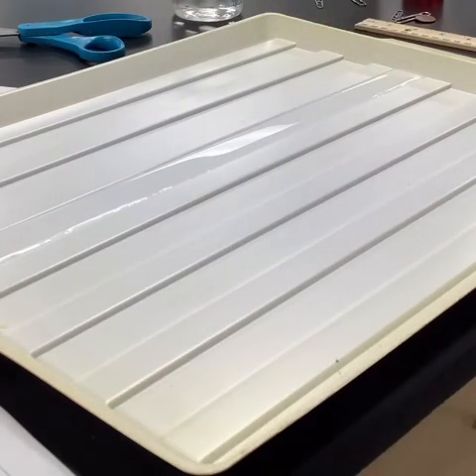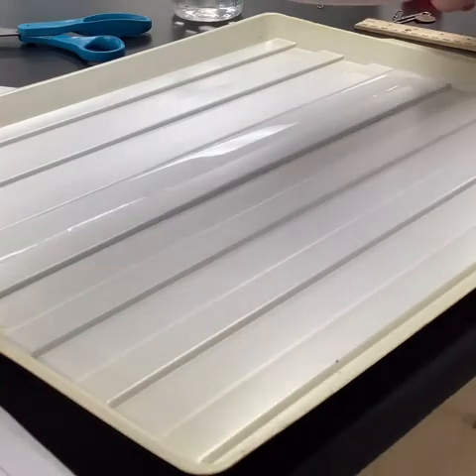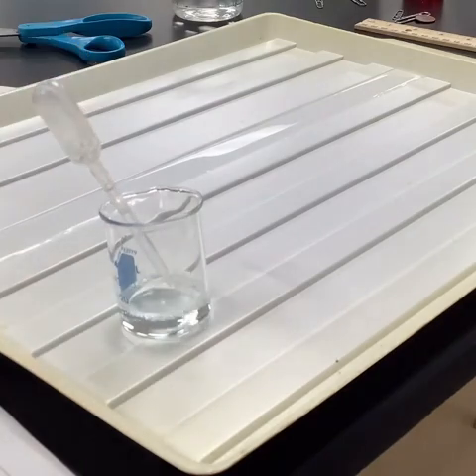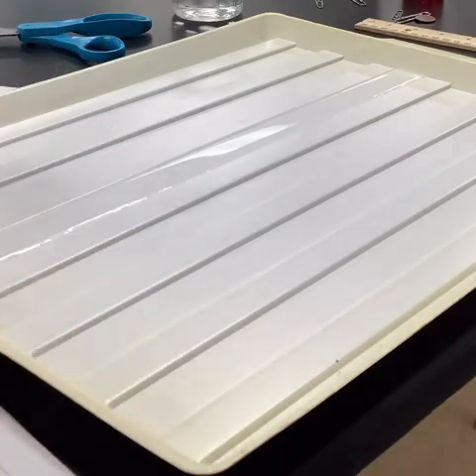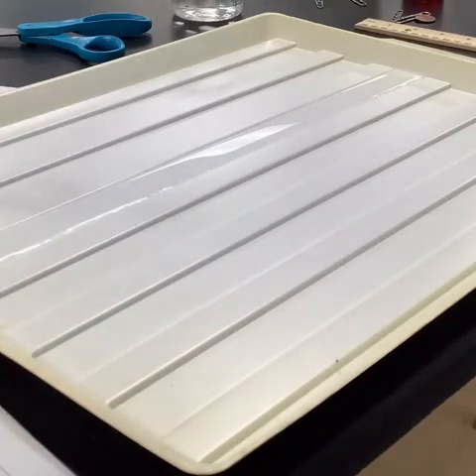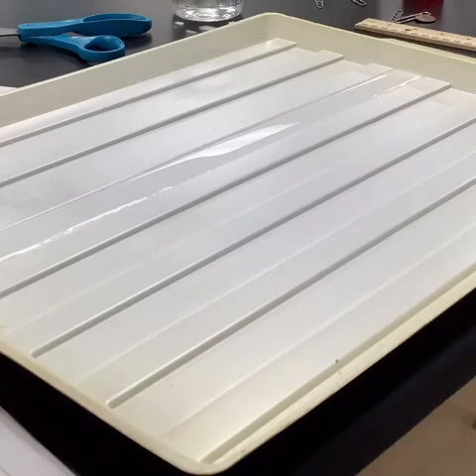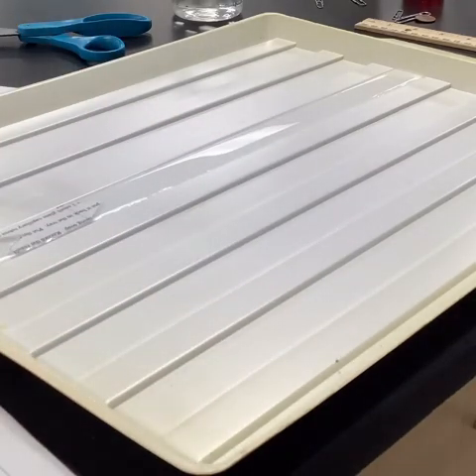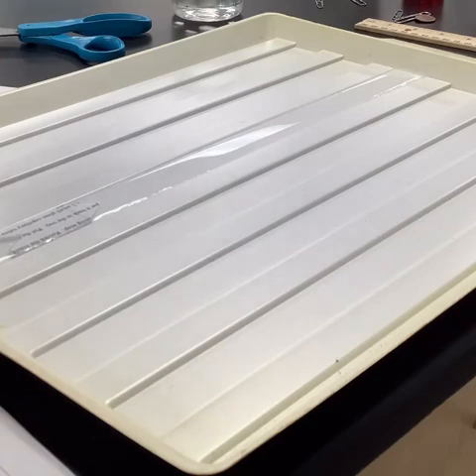And we're going to go ahead and float that in the water. Then what we do next is take a little bit of our soapy water. Let's put it on the other side there. We take a little bit of that soapy water and put a drop right back here in the notch. So we'll float it. The boat is floating right on top of the water. We take a little bit, and we're going to put one drop. That's all we need, one drop.